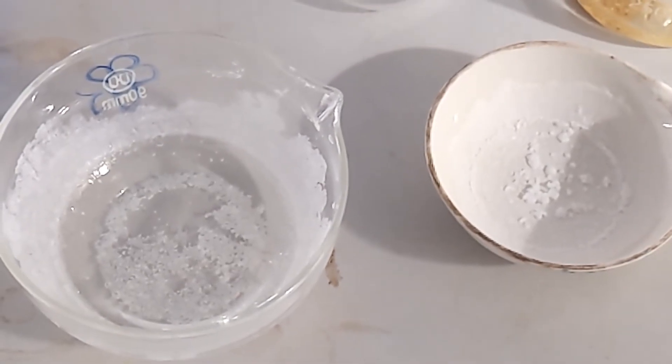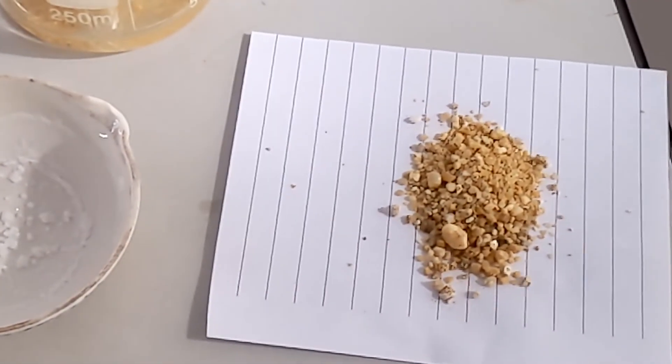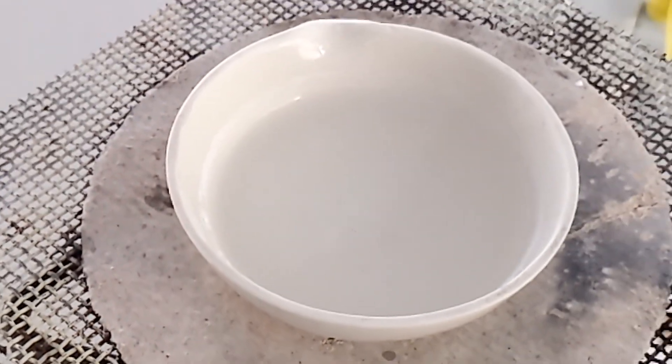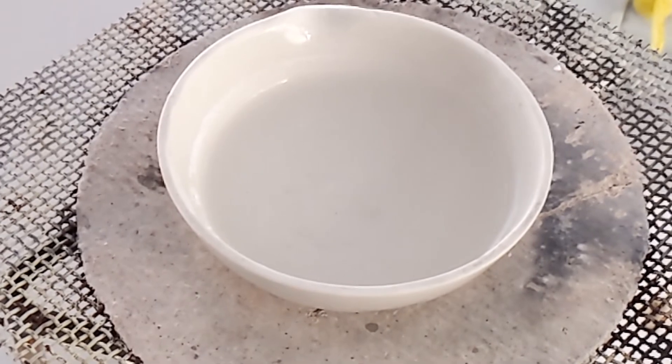Separating salt from sand. We're still evaporating with this one.